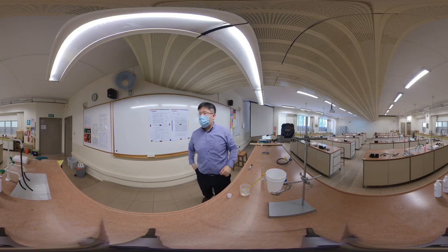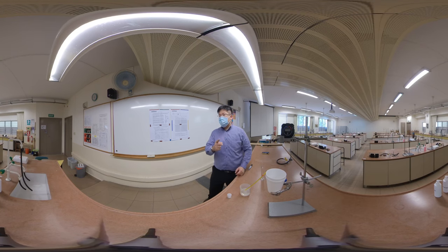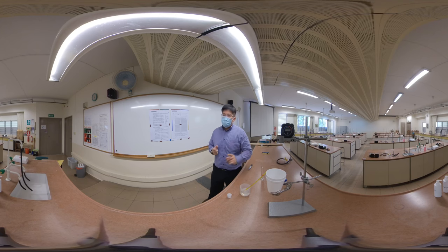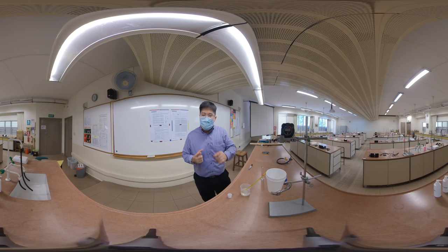Hey everybody, we are here again. Now we are doing practical 2011. This one is quite a unique one because it is based on temperature.